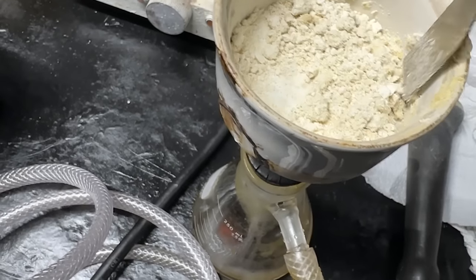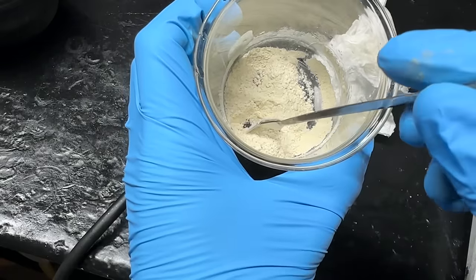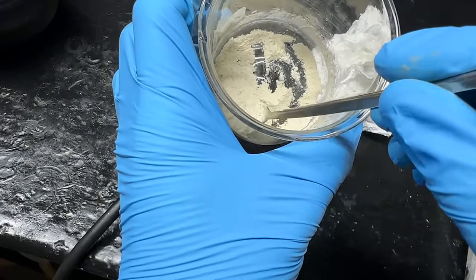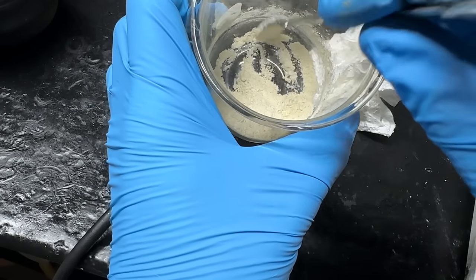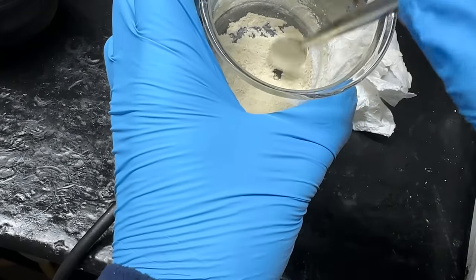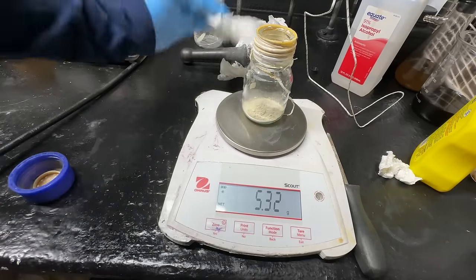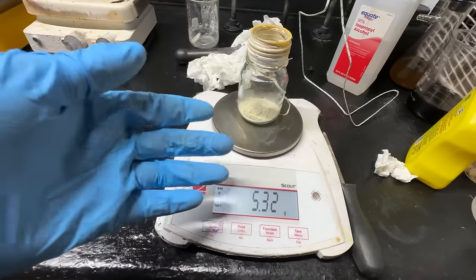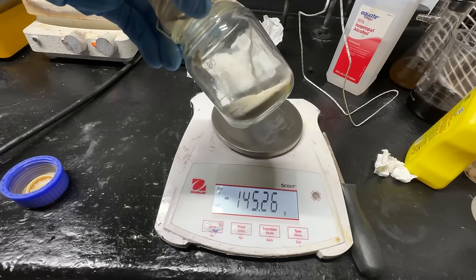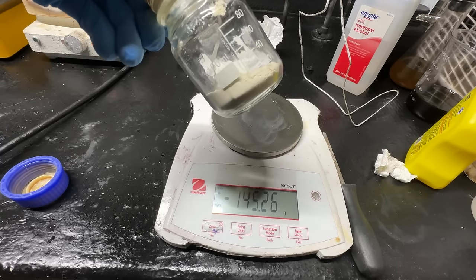I'm going to finish drying this, powderize it, and check our yield. This is looking very good — a nice white powder like it should be. Here's our final product: histamine dihydrochloride. It's a nice white to off-white powder, which is exactly what literature and chemical companies describe their histamine dihydrochloride as. Our final yield was 5.32 grams — an alright yield. We lost most of it in the solvent washing steps since we had to wash it so many times to get a nice fine white powder. There it is: histamine dihydrochloride, the essence of allergies.